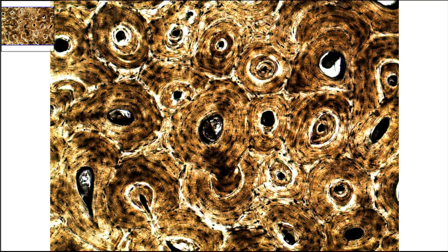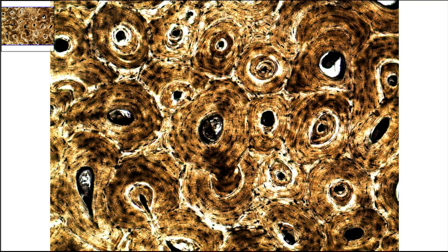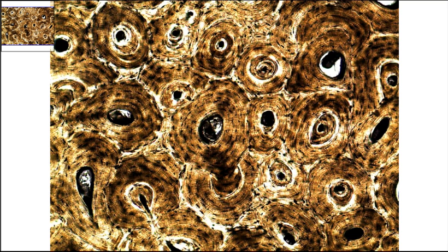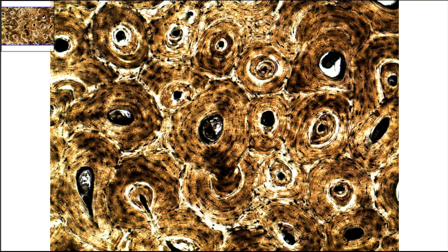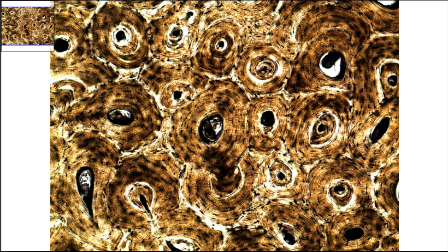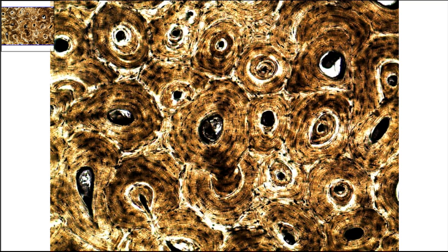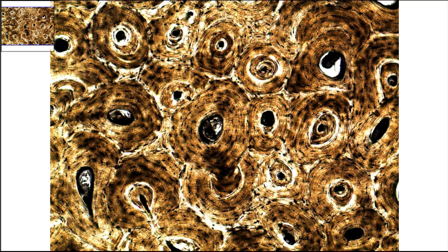This slide is of osseous tissue, the primary tissue that makes up bones. The current magnification is 100x total magnification. What we're looking for is the features of connective tissue and the specialized features of osseous tissue.